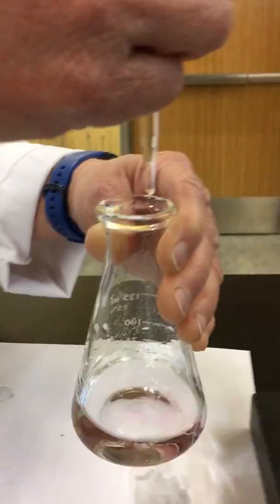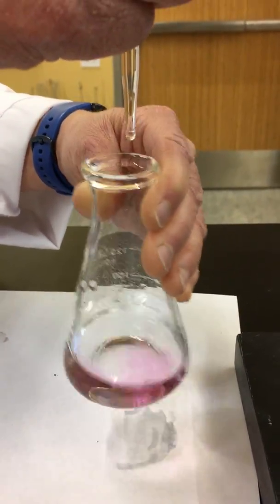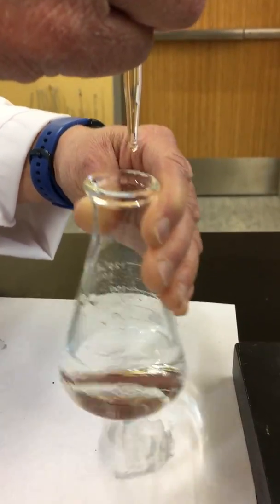At this point, we're switching to just adding one drop at a time. And we're getting really close.